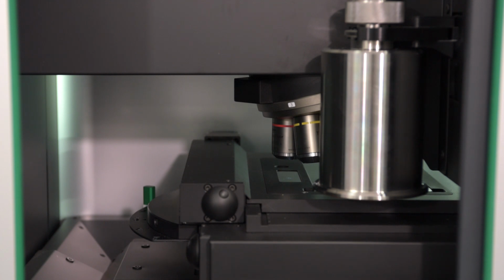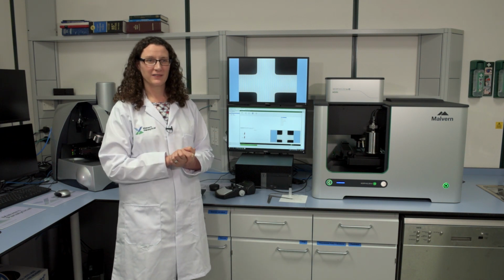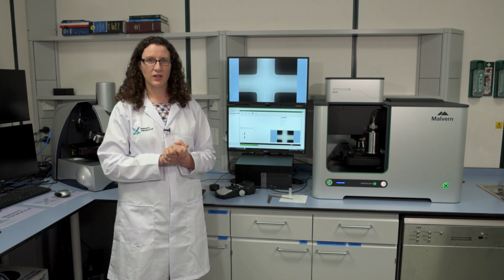The plate is now moved under the objectives, and the system does a couple more checks before it continues. You will note, of course, that I haven't touched anything since I've set it going. So although the system needs to do these checks, it's not your time. You don't have to be stood next to the system whilst it's doing them. If you set up your SOP correctly, once you've pressed go, you can leave the system to run.